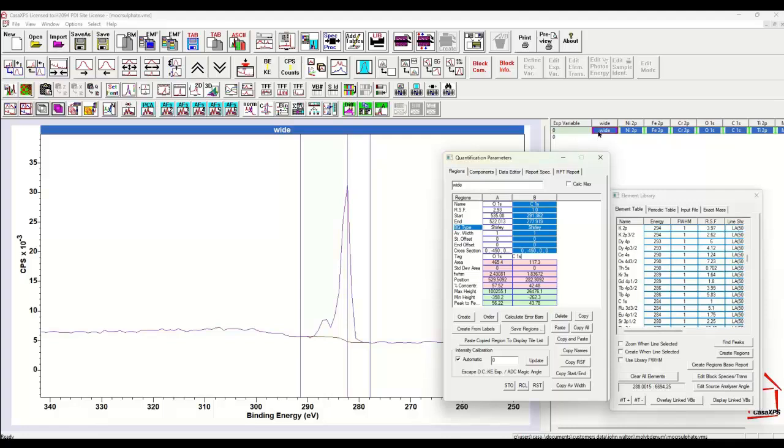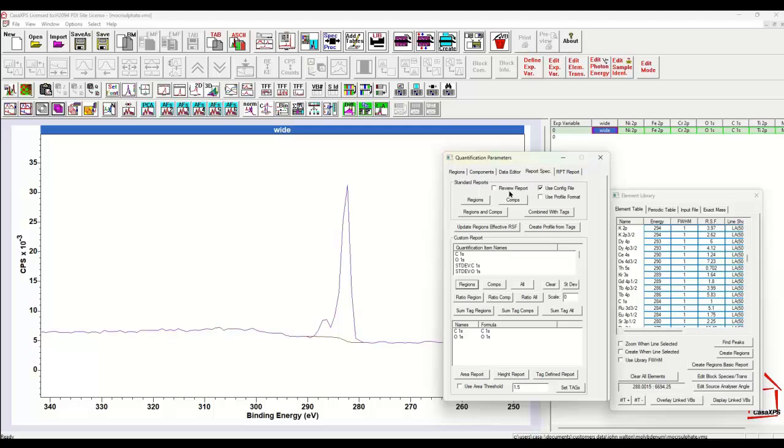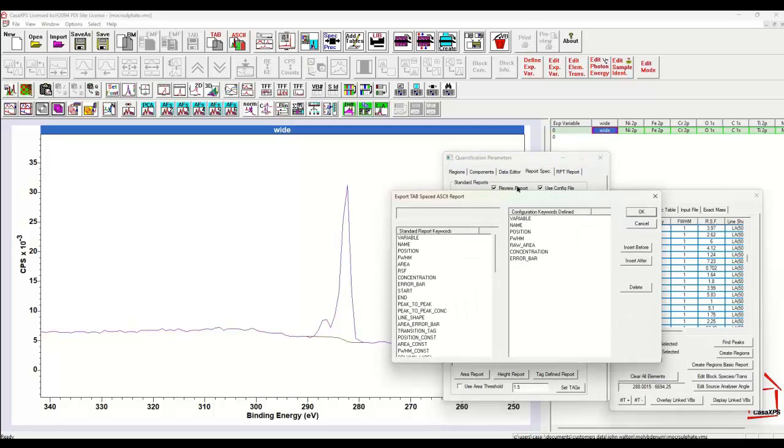Well, let me see. If I select the wide scan, because that's the one I'm working on, and I go to the report spec page, what I can do is in fact look at the regions in the standard report, and when I tick this button that says review report, it shows me the keywords that I used to define what I would like in the report, and I don't see mass in the report, so I need to look through here and add in the mass. So let's put, after the variable, I'm putting the mass, and I'll put the mass concentration. So this is only temporary. This will revert back to the configured file when I finish this calculation, but it tells me the different keywords that would be necessary if I wanted to work with mass.